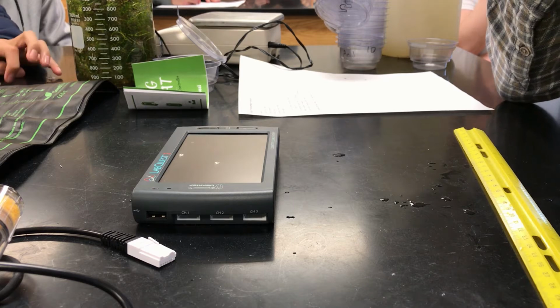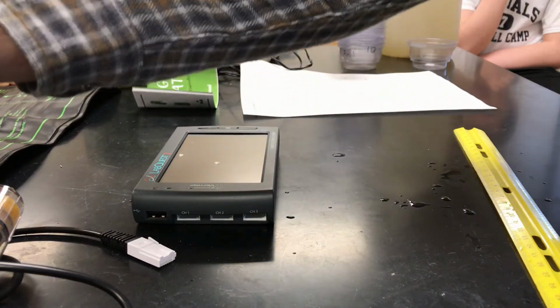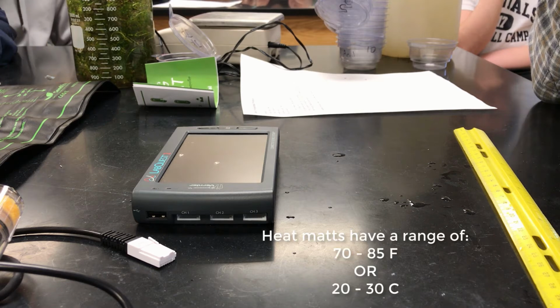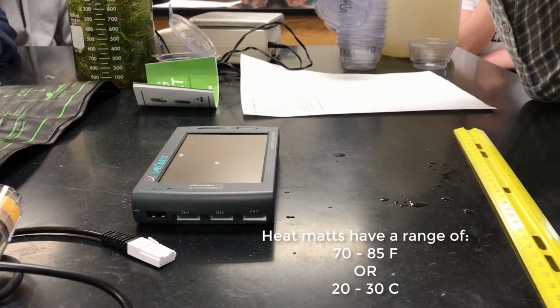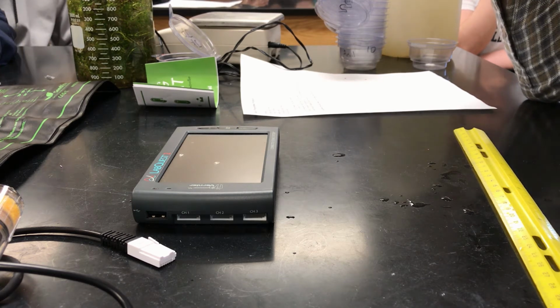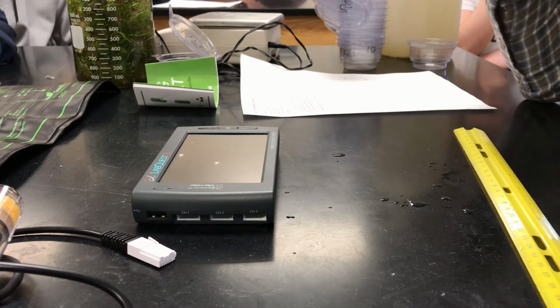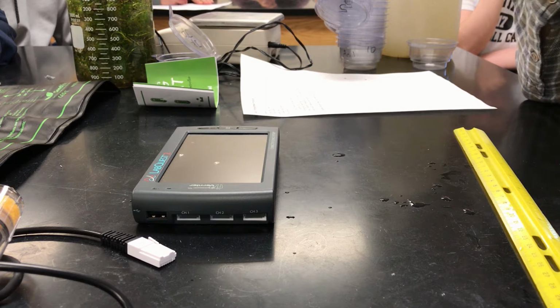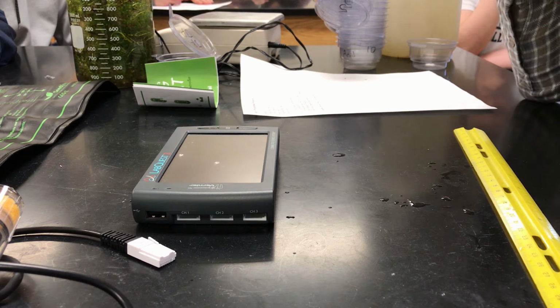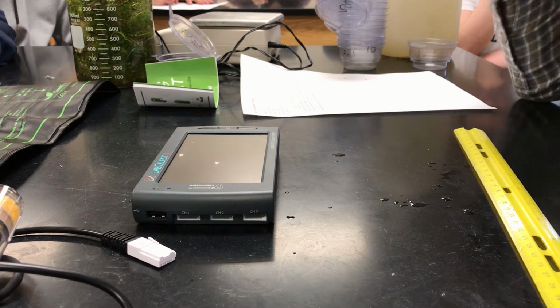Now, we adjust the different heating mats, and there's a controller that goes with that, and those controllers will allow you to change it from 70 degrees Fahrenheit up to 85 degrees Fahrenheit, which is also between 20 degrees Celsius and 30 degrees Celsius. I will tell you that 20 degrees Celsius, 70 degrees Fahrenheit, is roughly the temperature of the room. So I would recommend that you pick a temperature that is elevated by either 5 degrees Celsius, meaning try 25, or maybe go up to 30 degrees Celsius, but you will only change to one different temperature.